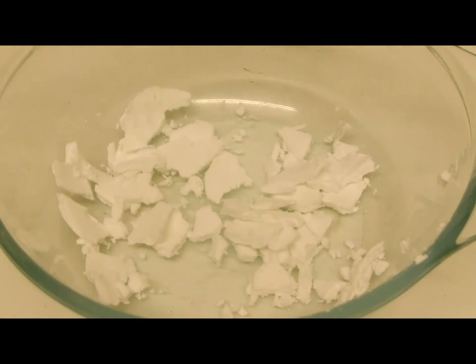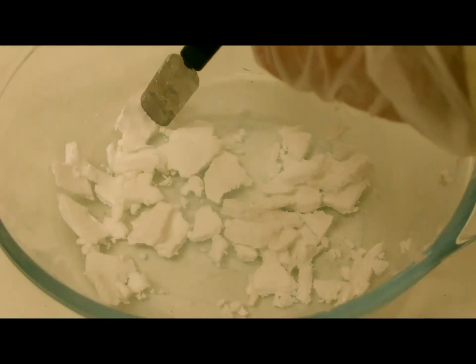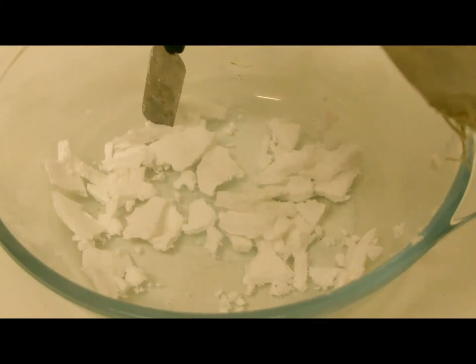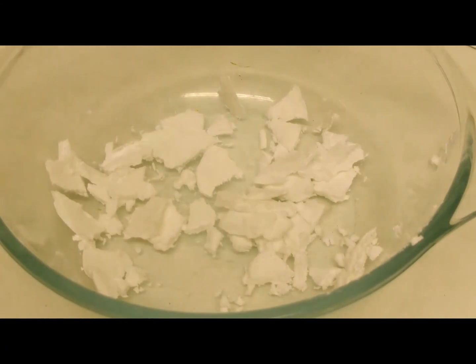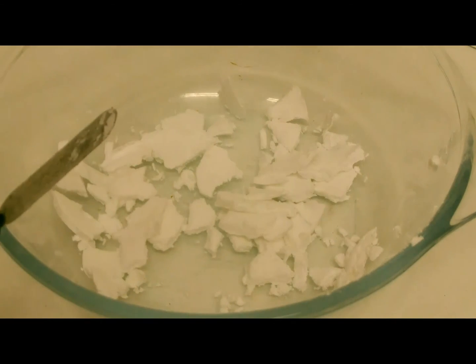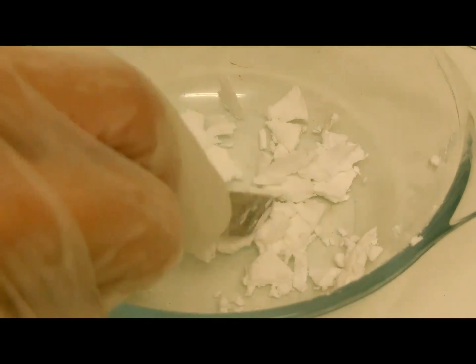So here is our very wet product which you can see sticks at the spatula, and you can continue purifying by recrystallization in ethanol or in water, or you can dry it at 90 to 100 degrees in an oven for several hours.